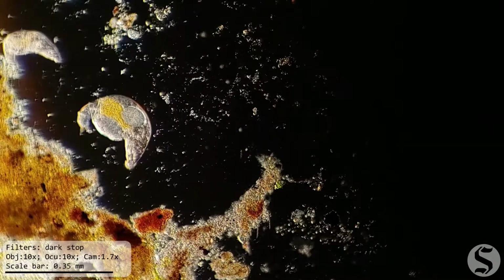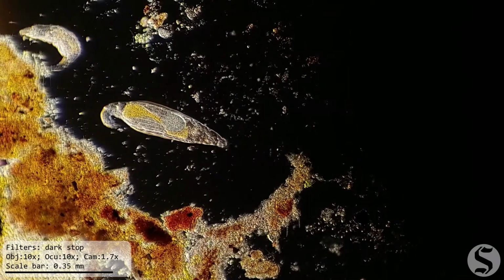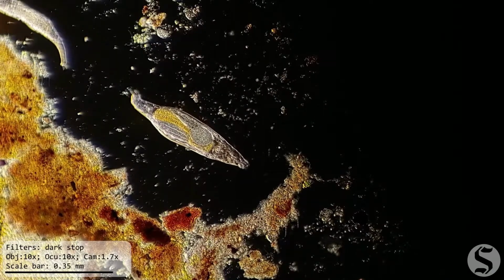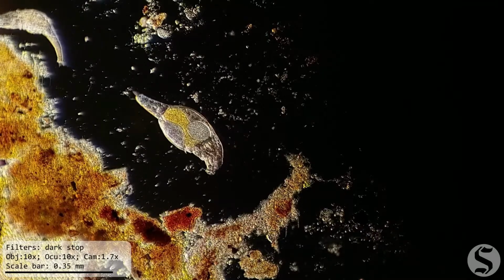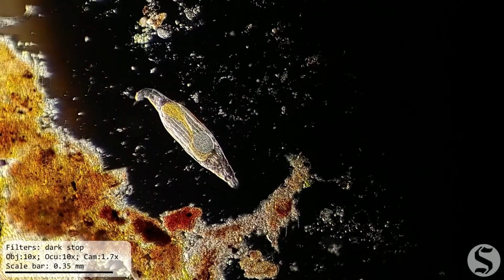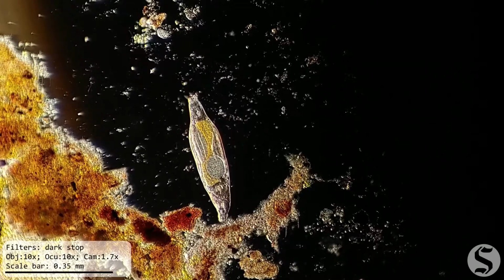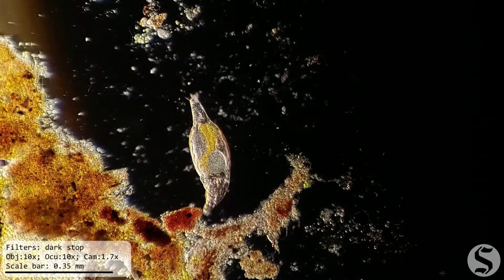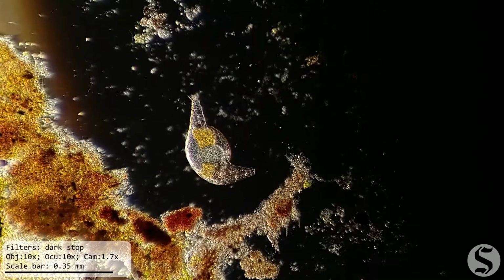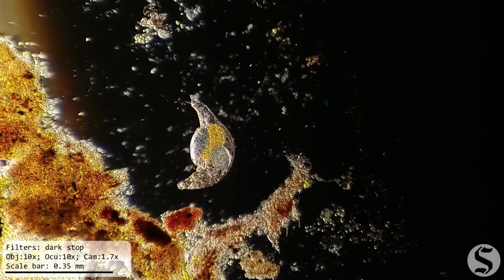I decided also to look at these guys under dark field, and that just looks stunning to me. It looks like it's full of silver and gold glitter. You can even see the texture of its skin under dark field. Rotifers are multicellular organisms after all. And I believe that the glittering gold part is the gut. It's been eating well. And the round silver part, I believe, is an embryo in there of a young rotifer. And I think the darker, longer silver pieces are reproductive organs. That just looks amazing.